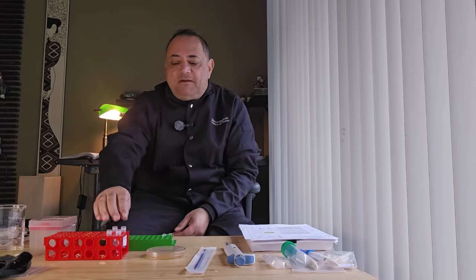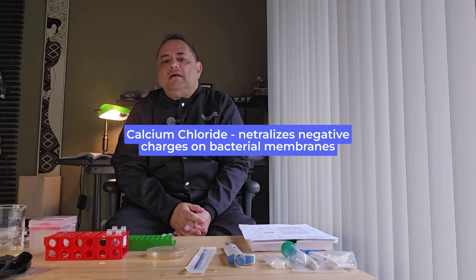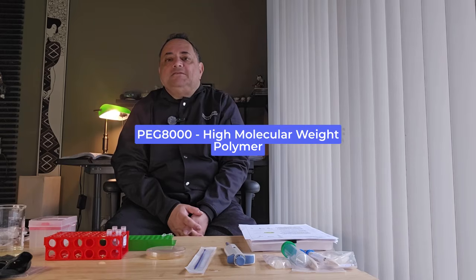We will use a transformation mix buffer, which I have here, and this buffer contains calcium chloride, which helps neutralize negative charges on bacterial membranes and DNA. Also in the bacterial mixture is PEG 8000.